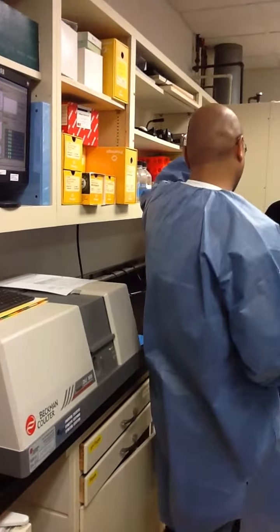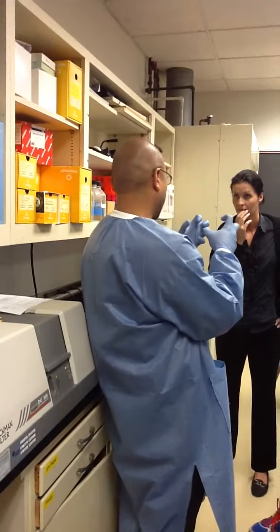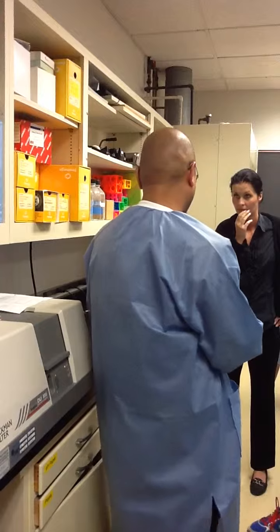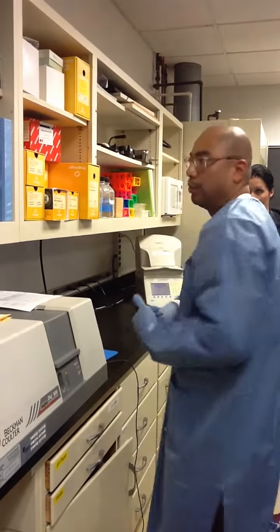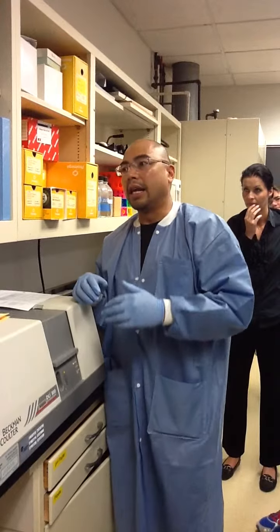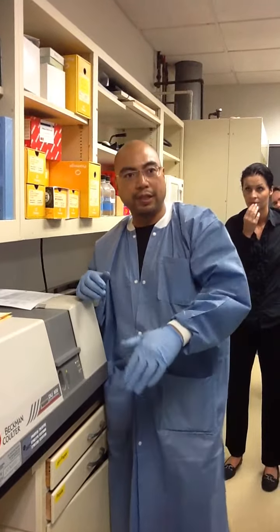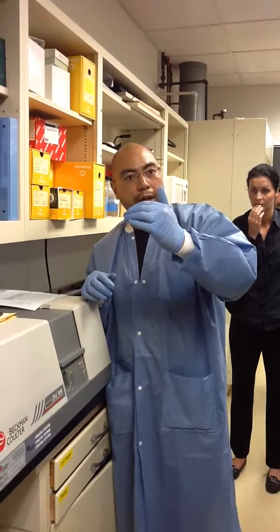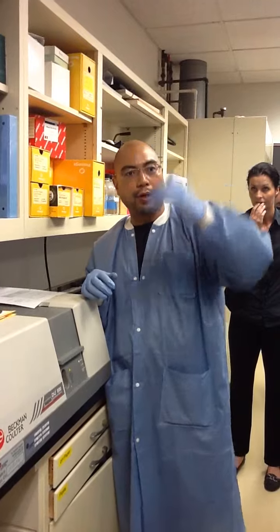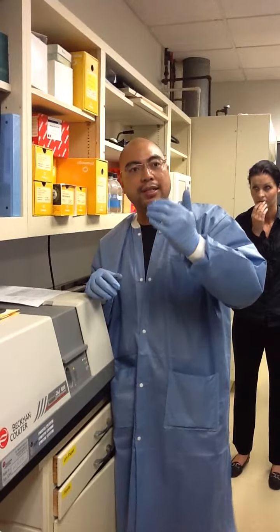As it finishes that PCR cycling, now you have a whole bunch of amplicon products. The data is not done there just yet. For standard PCR, it would be. But as part of the qPCR program, it will ramp back down to the lowest temperature, which is about 50 degrees. And in 1 degree increments, it'll start to measure, and take 1 degree snapshots of what the fluorescence is.